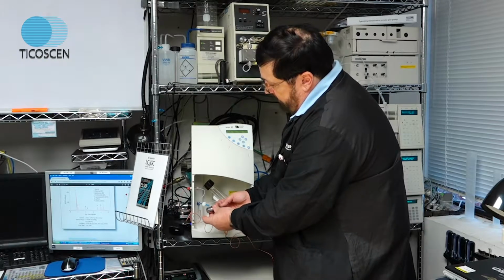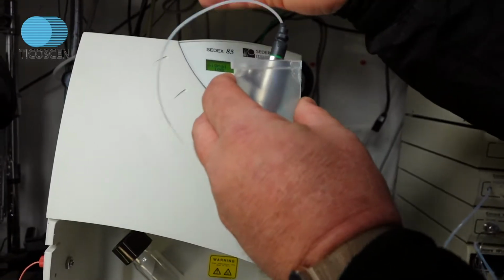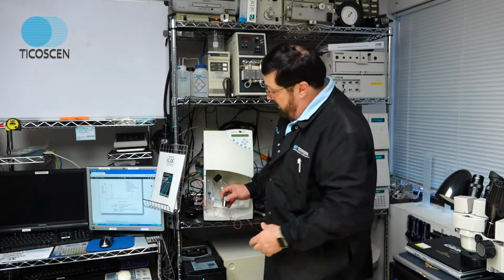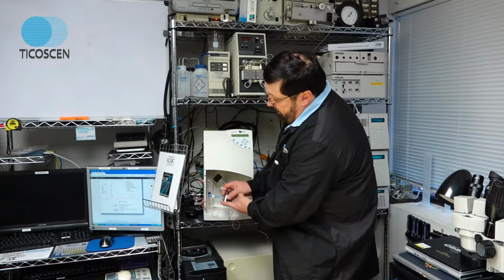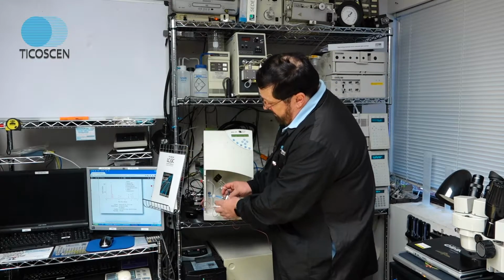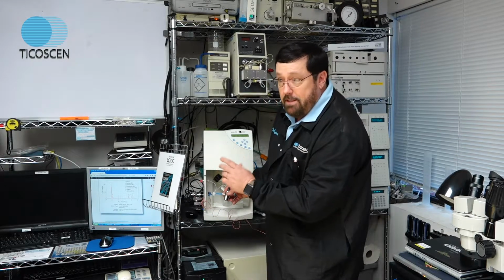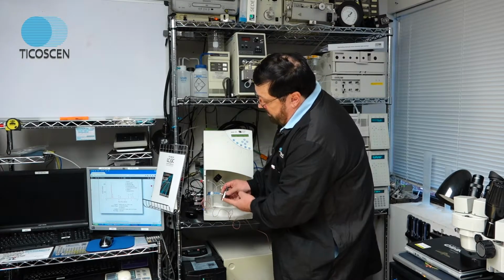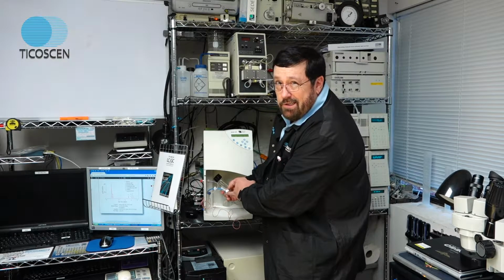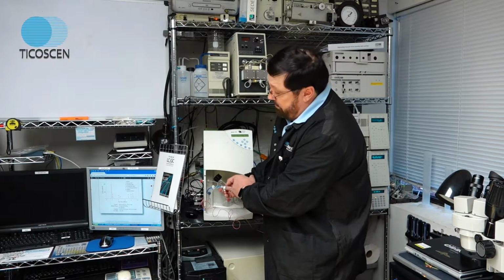What you want to do is take this out and put it into a 100 ml beaker. It's what we call partial submersion nebulizer sonication. You put it so it stays vertical with a 50-50 mix of methanol and water, and you sonicate it in a sonication bath. But do not sonicate the upper part or the plastics here, because that'll mess up the nebulizer. Just do a partial submersion sonication on this nozzle. This little tip here is where all the action is. You can barely see it, but it doesn't take much contamination to affect sensitivity and RSD right here.